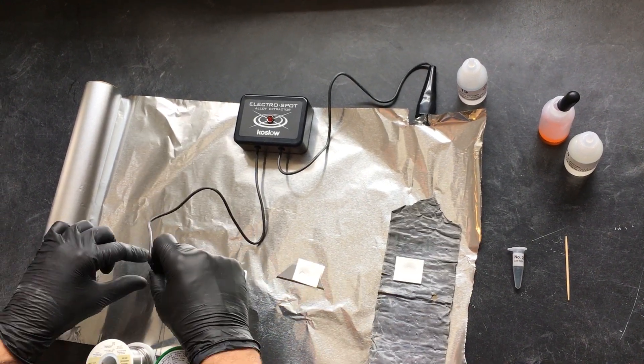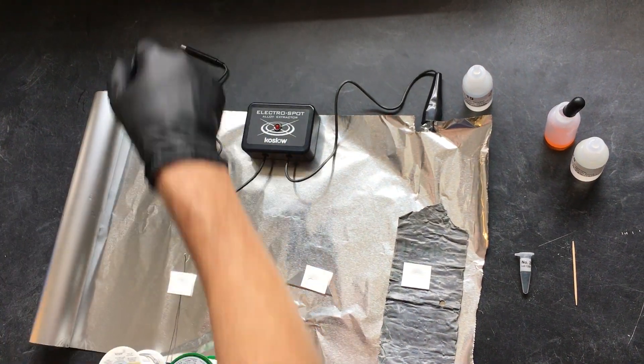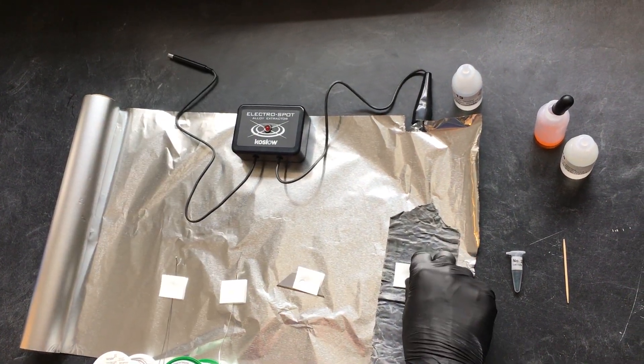Did that go? I didn't see if the light went on there. Let me try it again. Okay. All right. Turn the paper over.